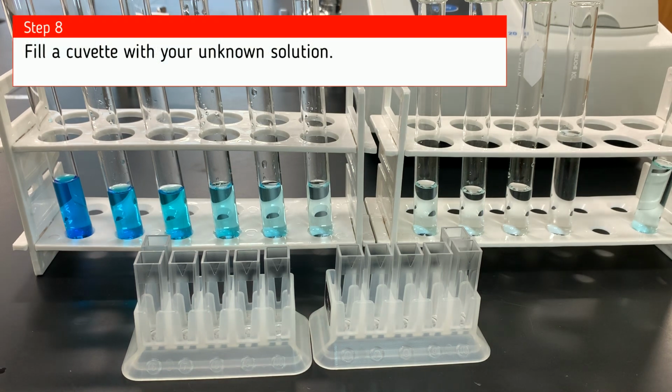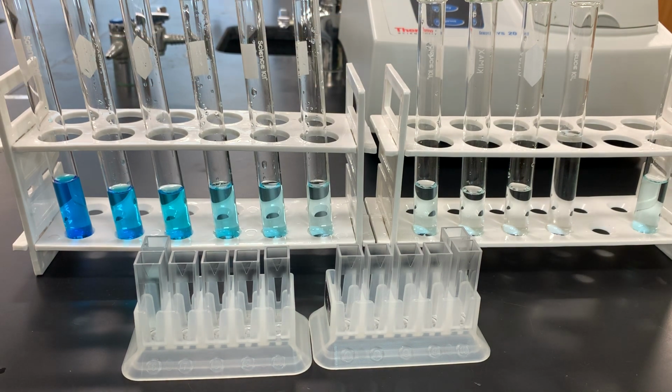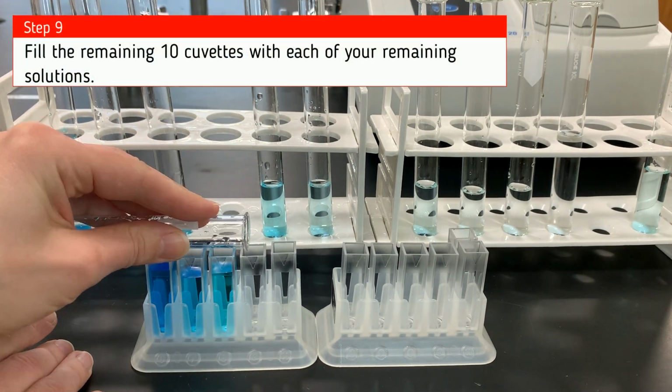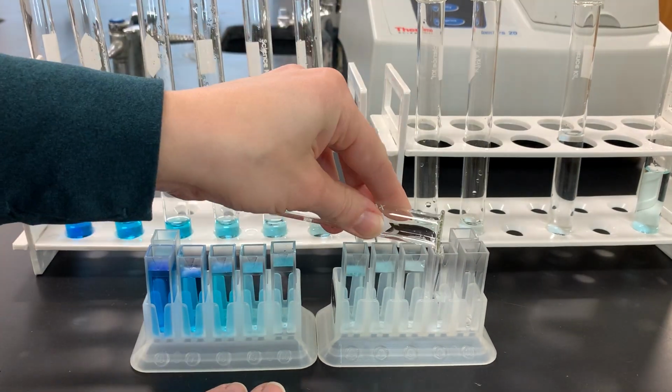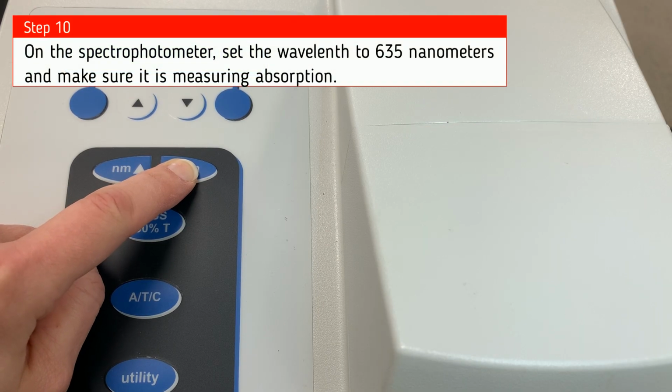Now I'm going to fill a cuvette with my unknown solution. Then I'm going to fill the remaining 10 cuvettes with each of the remaining solutions in order so I can keep track of them, make sure I don't get them mixed up. Now we're going to move to the spectrophotometer.